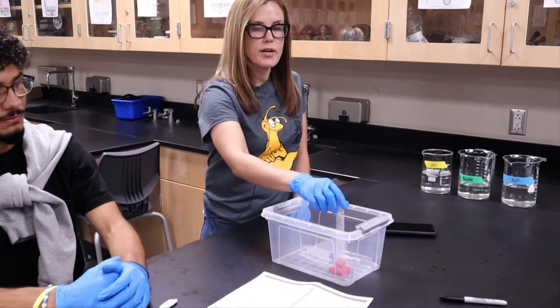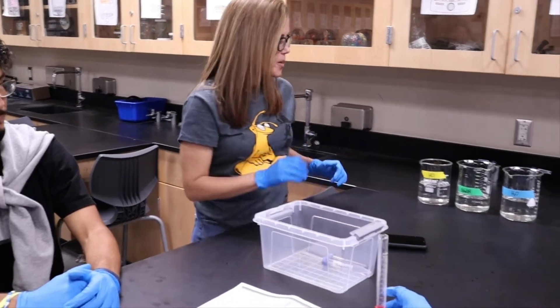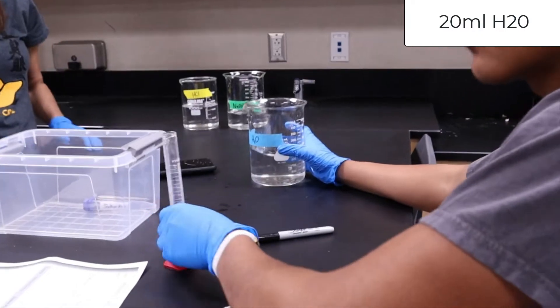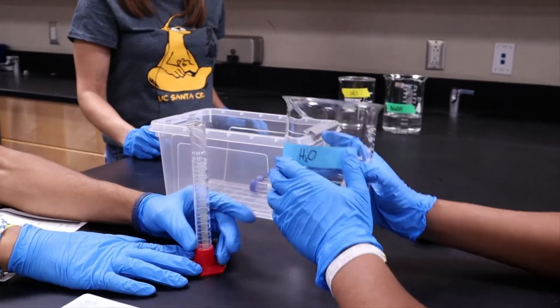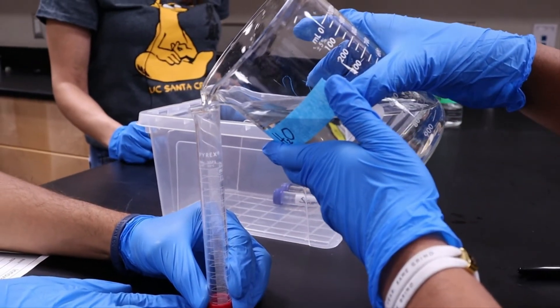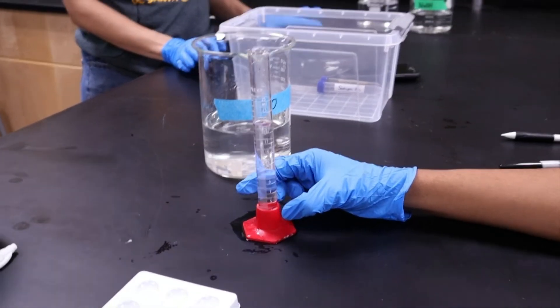We're going to measure out, using our graduated cylinder, 20 milliliters of each of the substances. Start with the water — 20 milliliters of water using your graduated cylinder. Now that you have your 20 milliliters of water, pour that into your cup labeled H2O.